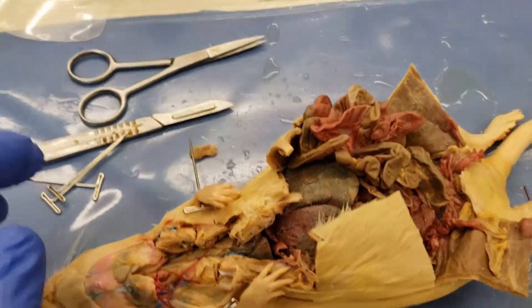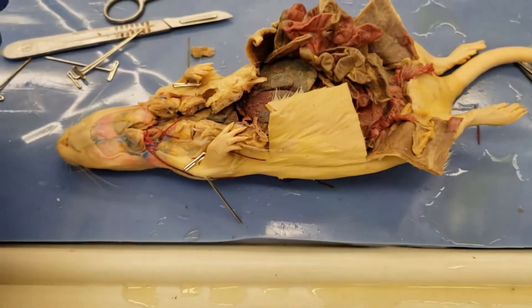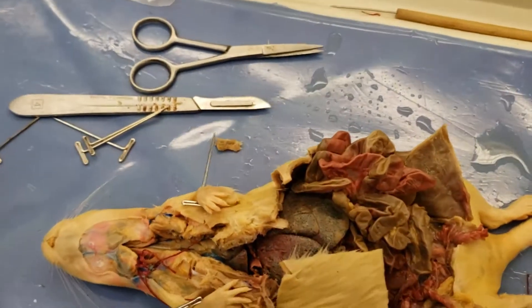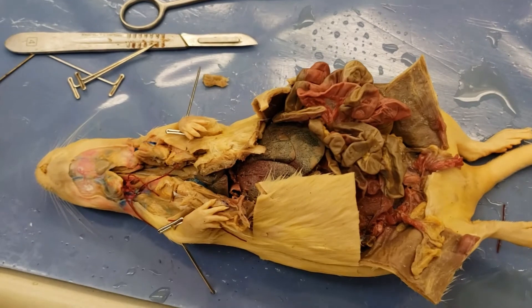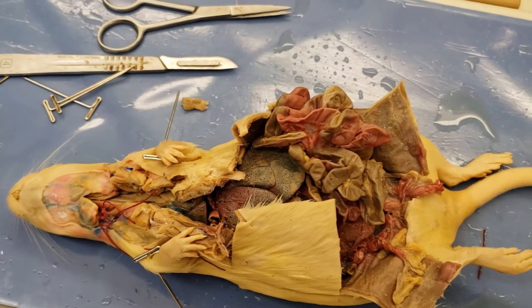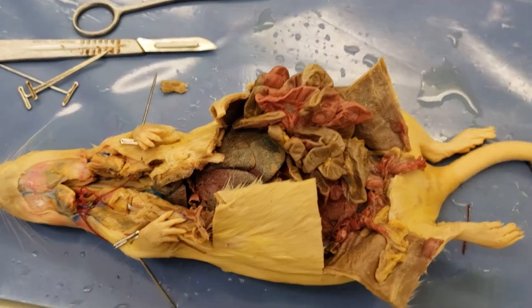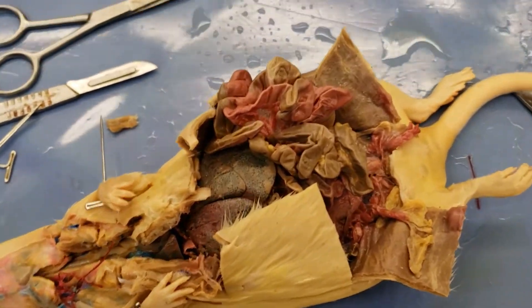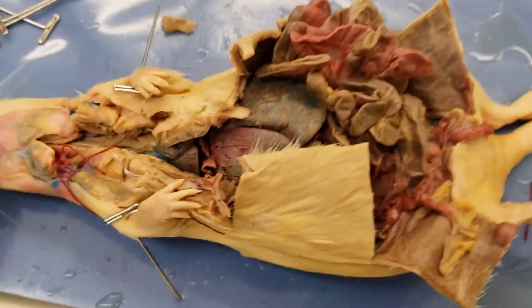Hello everybody. So this right here is a rat. I've cut it open and welcome to the rat dissection section. I'm going to go through and look at some of the visuals of this cut-open specimen and identify some of the major structures you have to know for your week one objective sheet. So without further ado, let's get going.